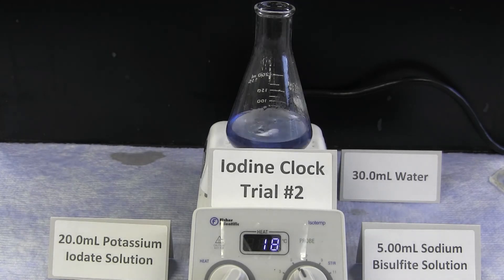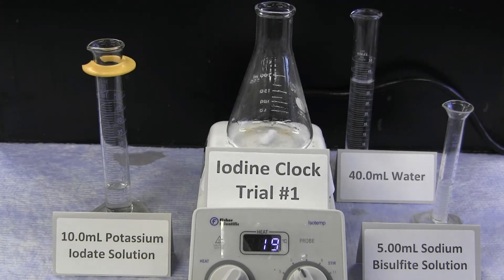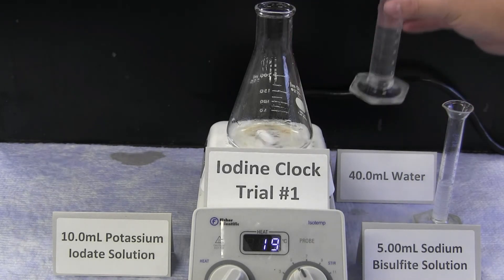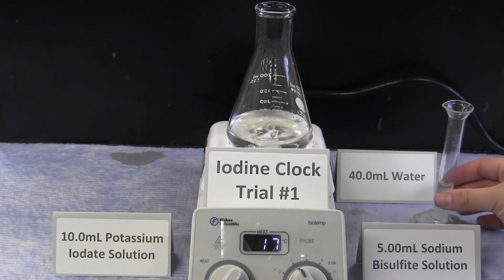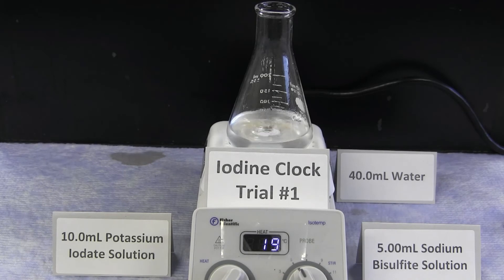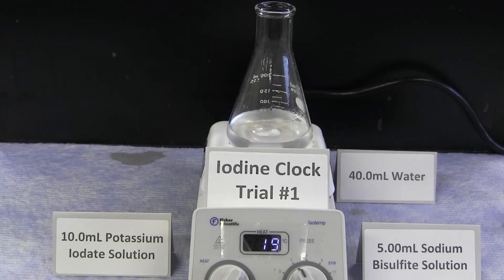The blue color means that the reaction is complete. The last reaction combination uses the most dilute concentration of potassium iodate. 10 milliliters of the potassium iodate solution is combined with 40 milliliters of water, and again 5 milliliters of the sodium bisulfite solution. Being the lowest concentration, this reaction combination will take the longest amount of time.